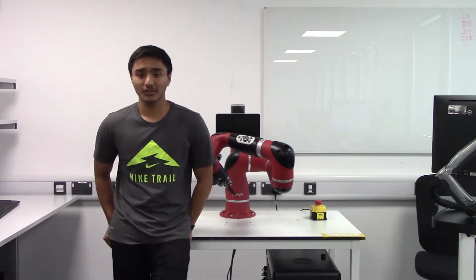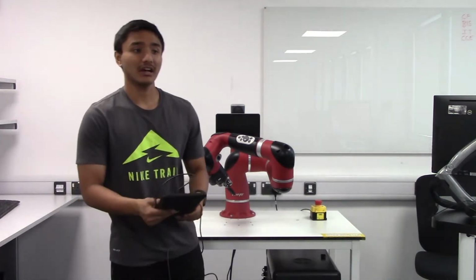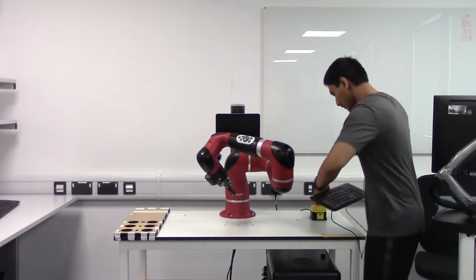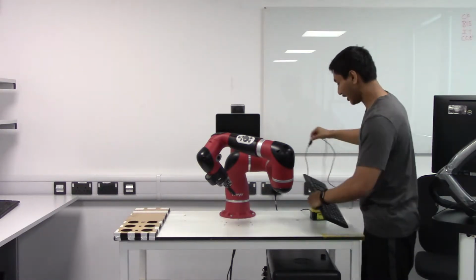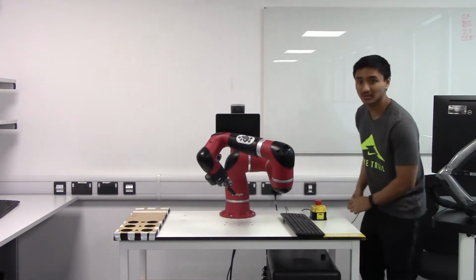The first thing to do is to connect the keyboard to the robot. To do this, plug in the USB port to the outside USB port of the controller, not the ones inside. The ones inside are just used for debugging by a Rethink employee. The USB ports are covered by caps, so remove them so that you can see the USB ports.